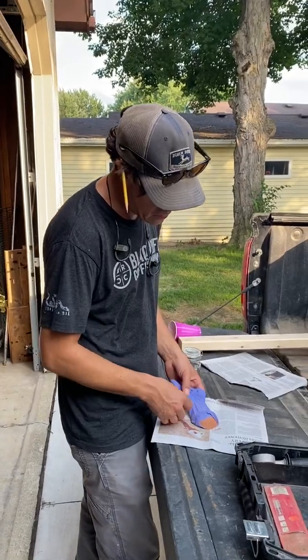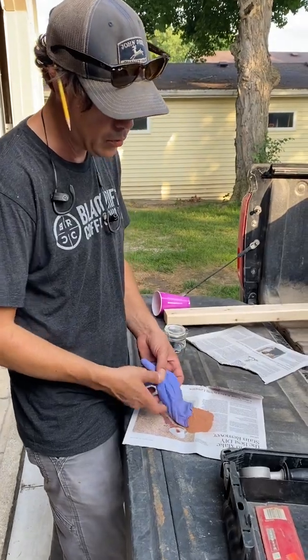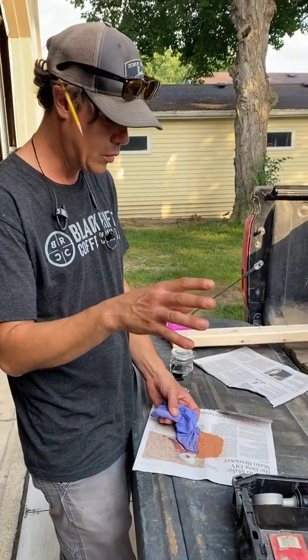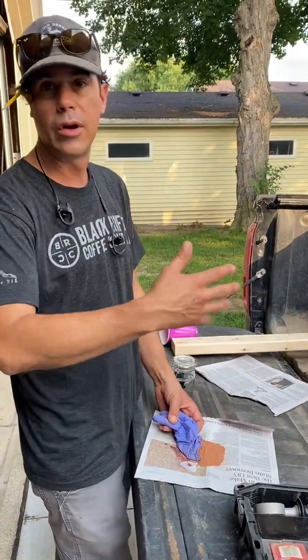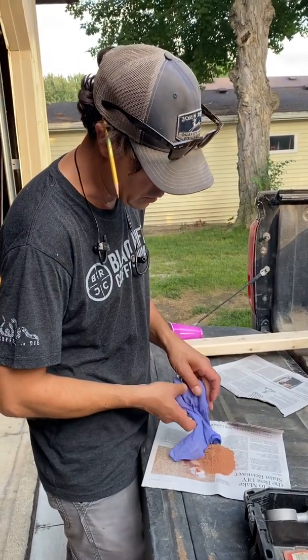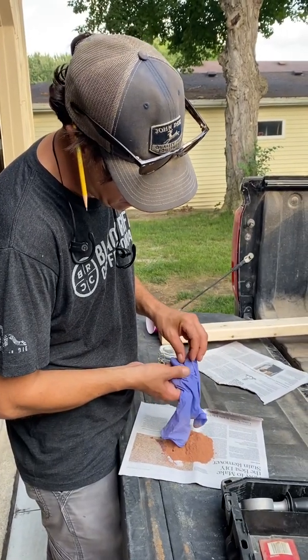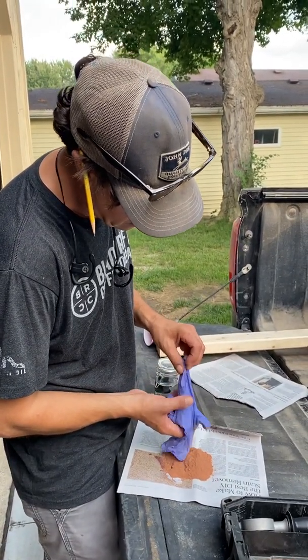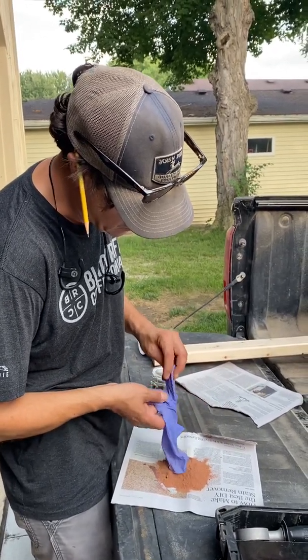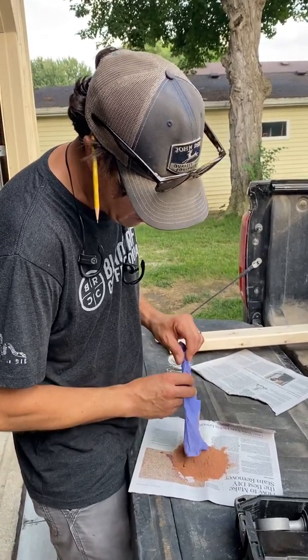The first thing we want to do is check if it's a homogeneous sample, which means did you take the sample from one section that has a unique profile that's going to give us a weird sample, or is it a conglomerate, right? Is it a representative sample of all of the soil that we're dealing with here? And it looks pretty uniform, right? Just looking at it. And already looking at it, you can tell it's like baby powder. So it doesn't surprise me that you have a dust problem, right?